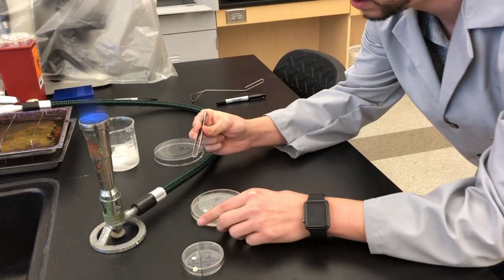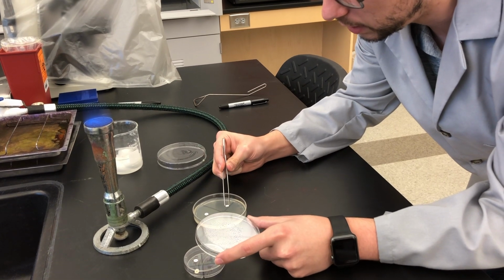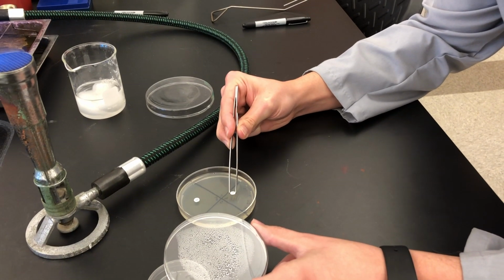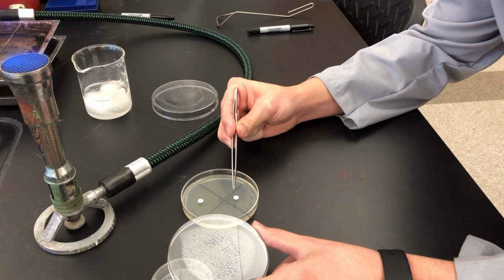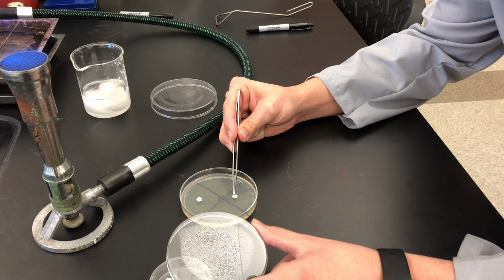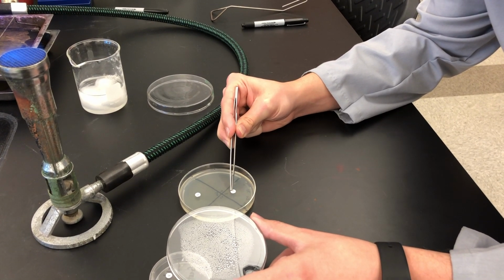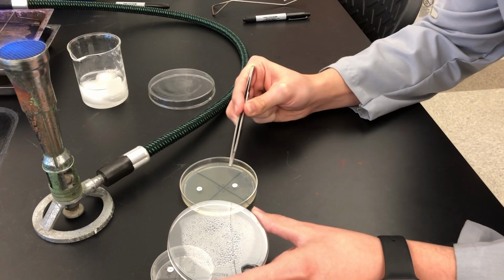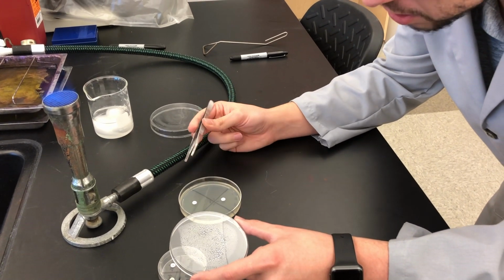It has a P label. Find your P label on the bottom of your plate and drop it in its respective quadrant. Okay, tap it in. Notice that this is not exactly in the middle of this quadrant. Even though I divided this out 4 by 4, my lines are not exactly even, my quadrants aren't even.